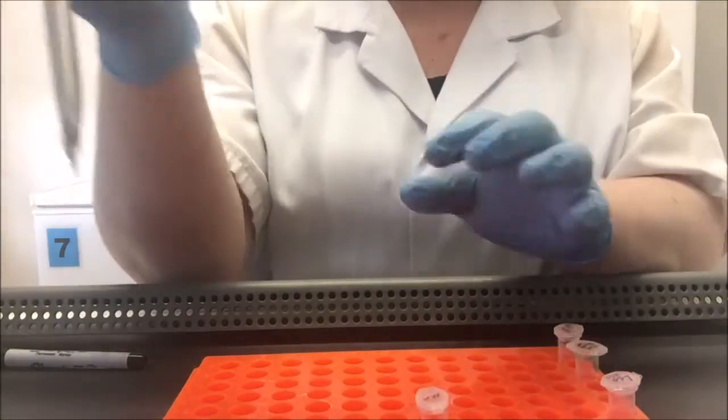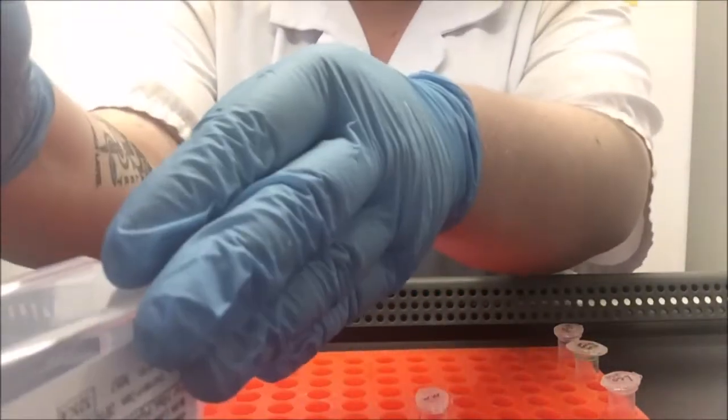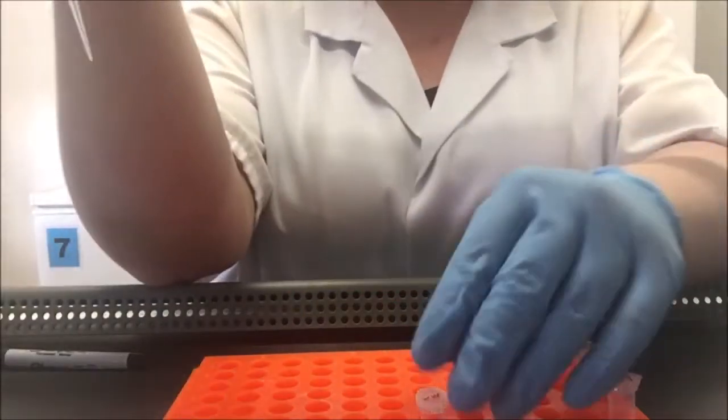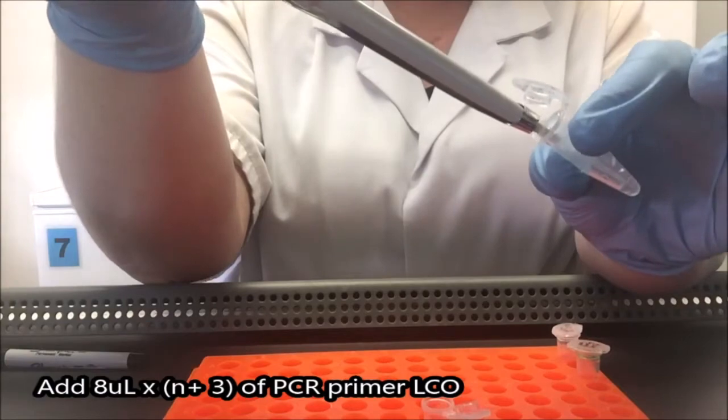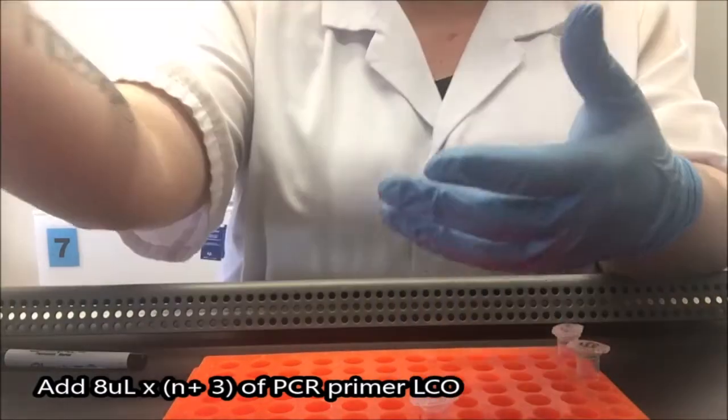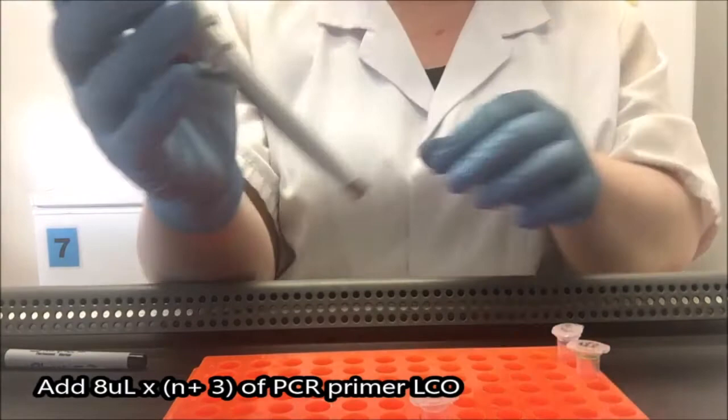Now I'm going to add the same volume of my second primer. You always need two primers and they have to be a matching set that will amplify the same fragment of DNA.